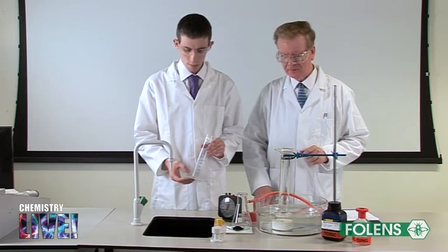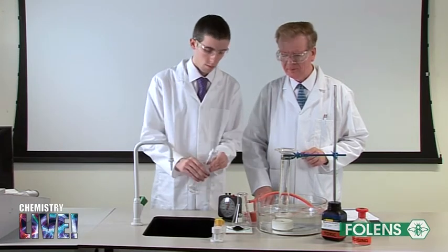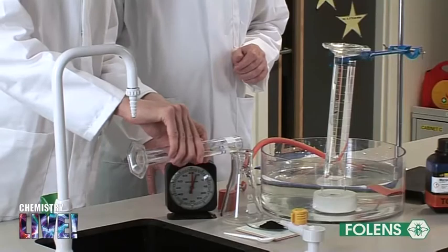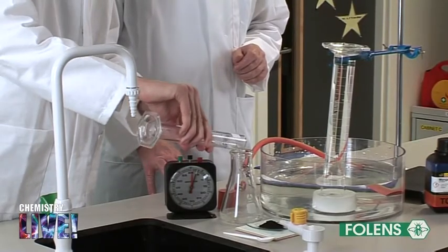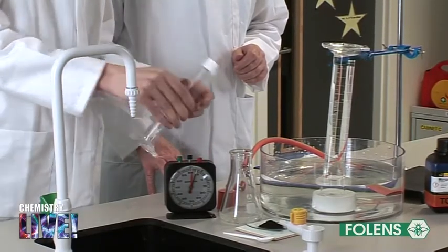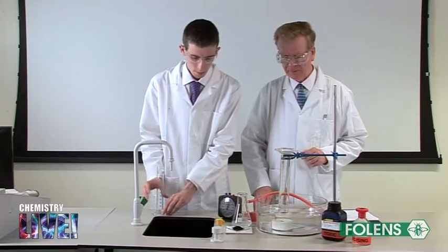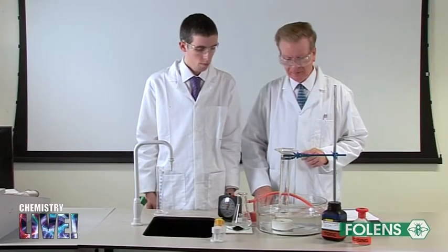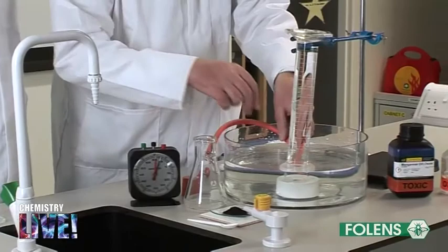Place 50 centimetres cubed of the 20 volume hydrogen peroxide solution in the Buchner flask. Place the end of the delivery tube under the graduated cylinder.